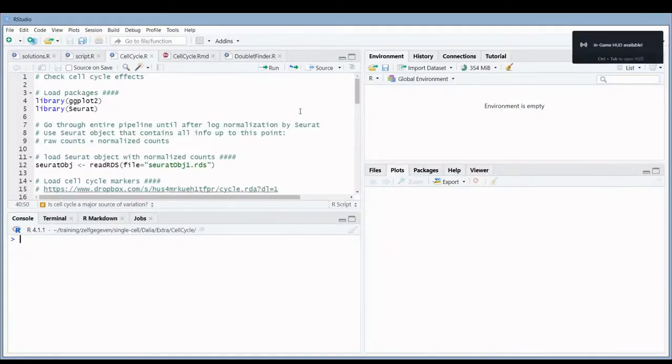So this script is a script that you can plug in onto the basic script. The goal of this script is to check if there are any cell cycle effects in the data. So what are cell cycle effects?